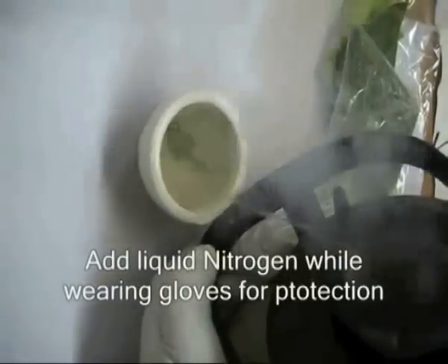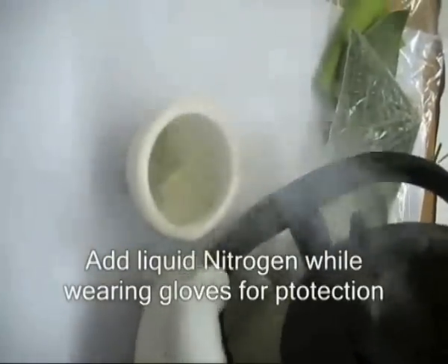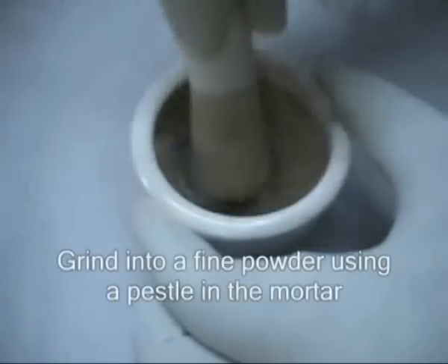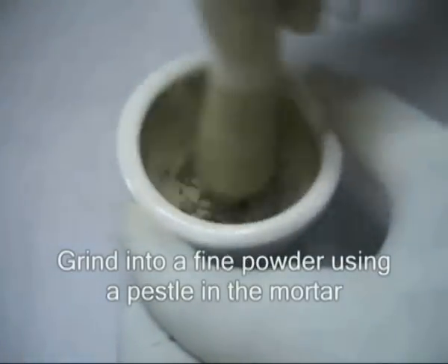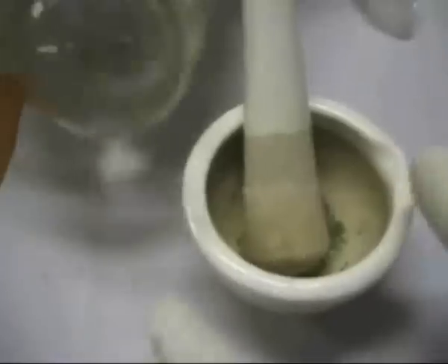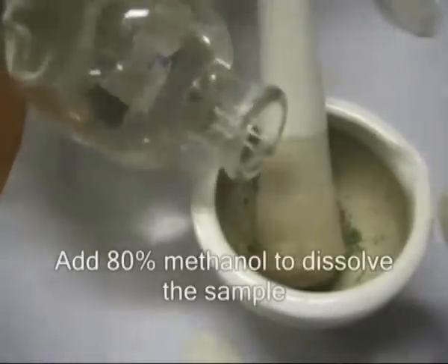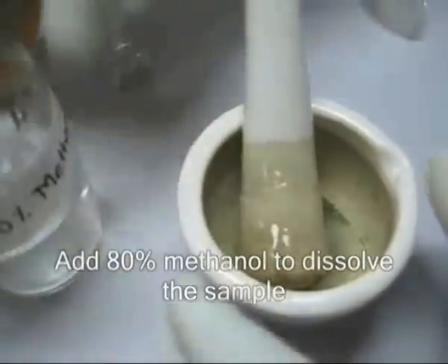Rice leaf samples are cut into small bits and ground using pestle and mortar in liquid nitrogen. Gloves are to be worn for safety. Methanol is the solvent used for dissolving the sample.